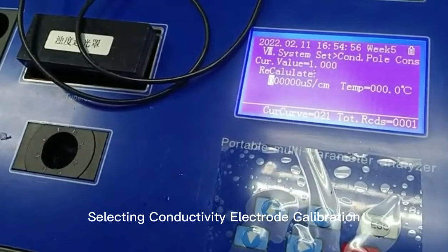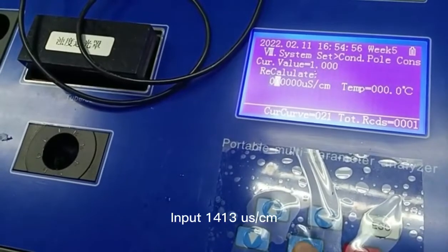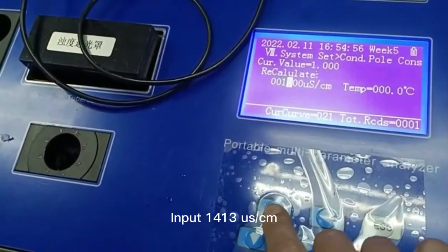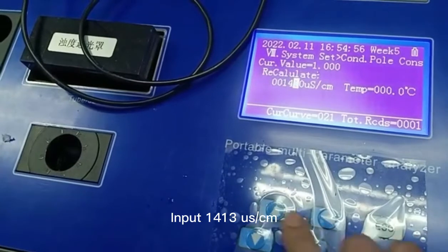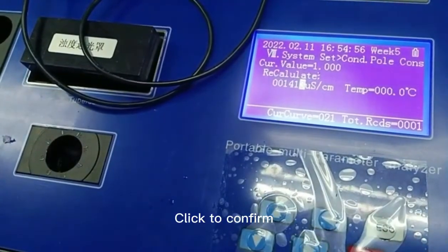Selecting conductivity electrode calibration. Input 1413 uS/cm. Click to confirm.